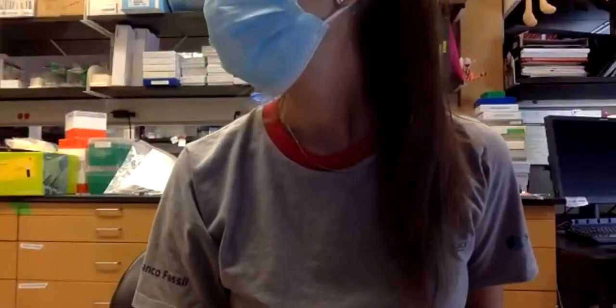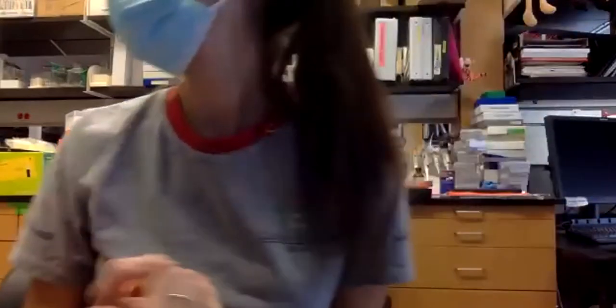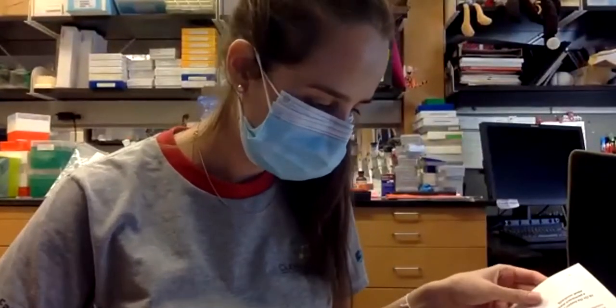So we have to wait 10 minutes and we will then do the rest of the steps. And in the meantime, maybe we can answer some of the questions that there are in the guide. Let's see. We have 10 minutes.